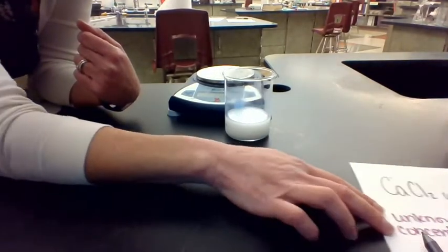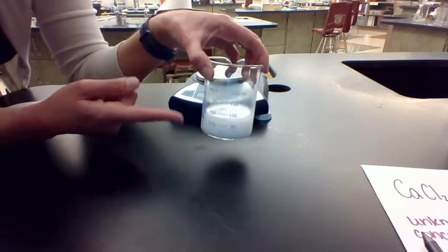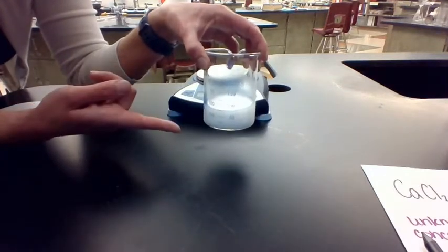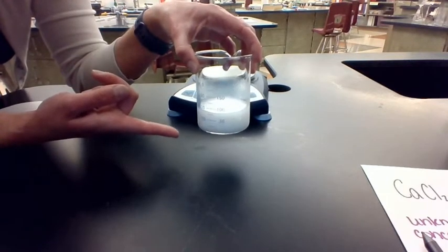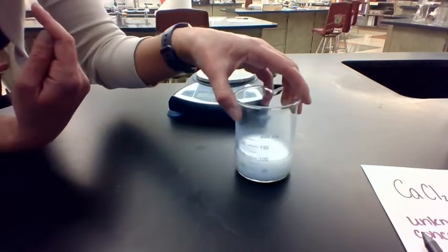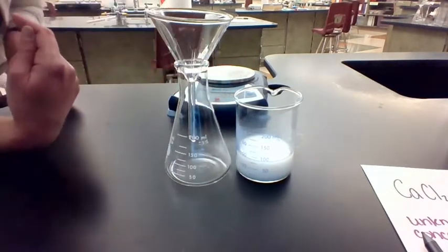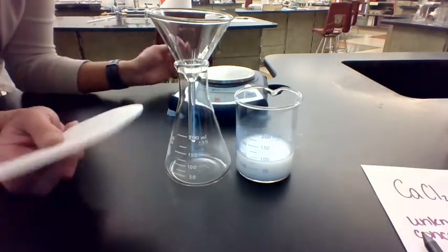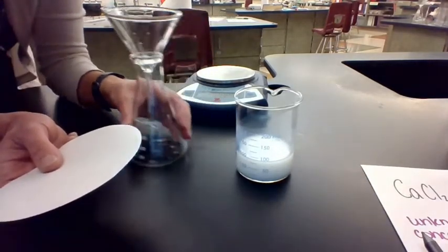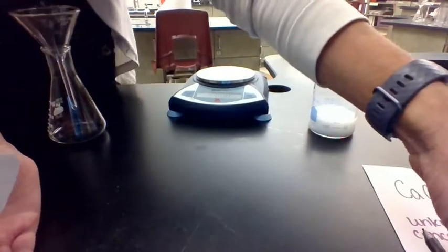Right now, this is a mixture. It's got some solid in it, but there's some other stuff in it as well. So in order to separate a mixture, if we have a mixture of solid and some liquids and solutions, we can filter them. Okay, so we're going to take a piece of filter paper, and we're actually going to weigh this filter paper first. So let's pause and record this piece of information in our data table here.